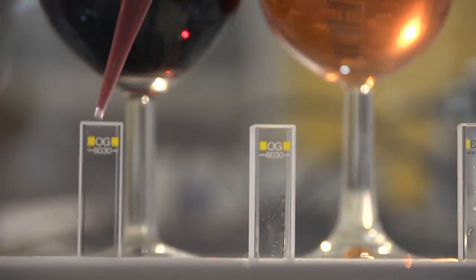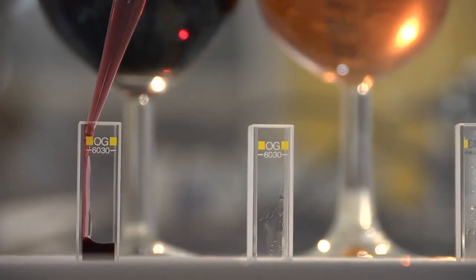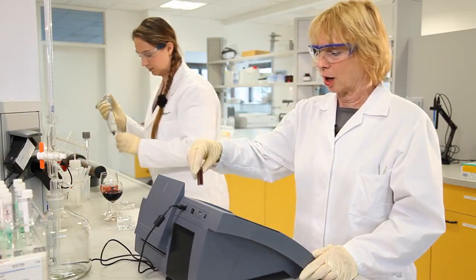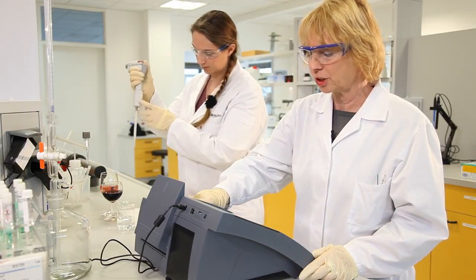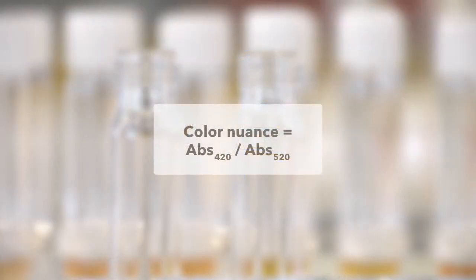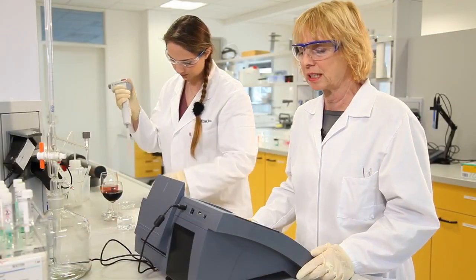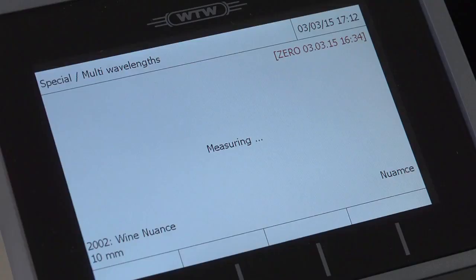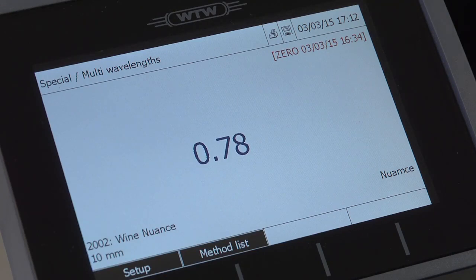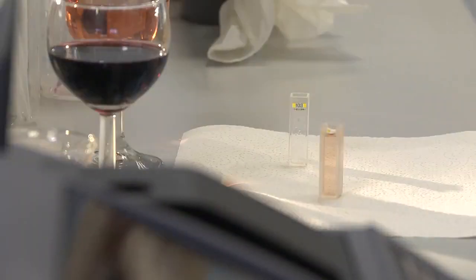The difference in color between a rosé and red wine is obvious. First, I'll determine the color nuance of the red wine. Color nuance is the absorbance ratio between 420 and 520 nanometers — two wavelengths are measured and then calculated against each other. We have a reading of 0.78, which means that it falls in the violet range.